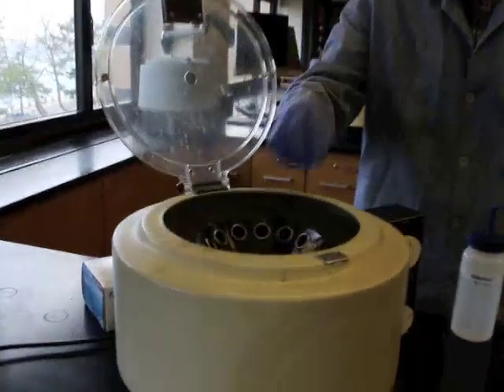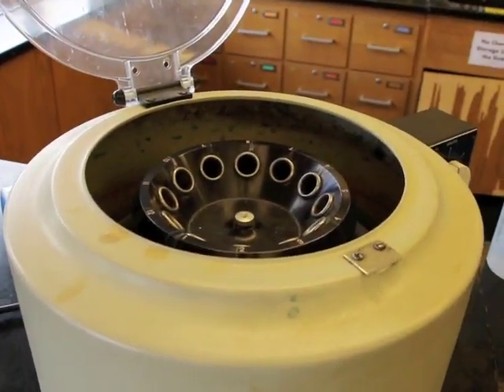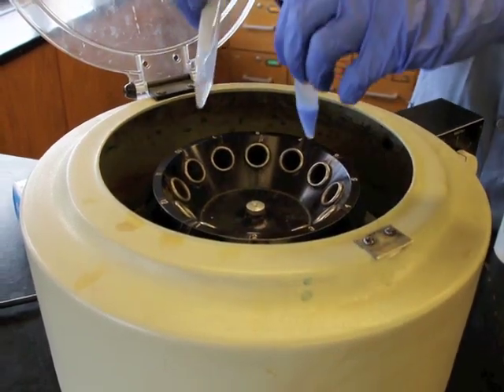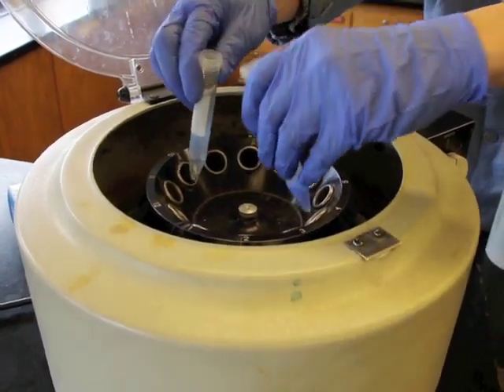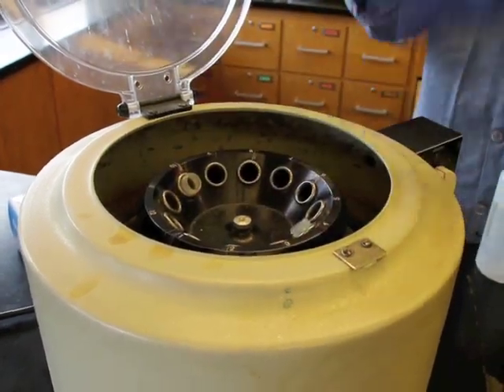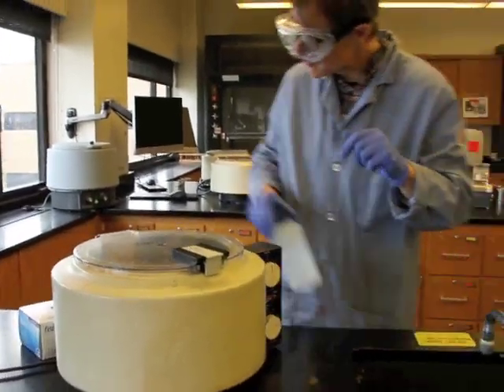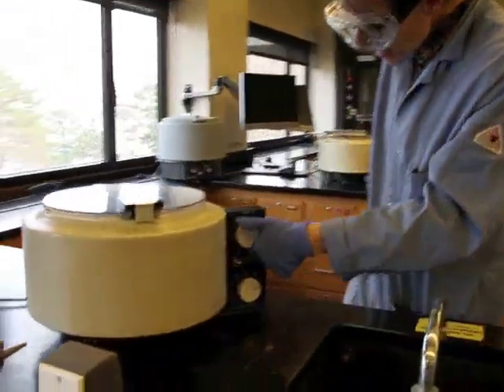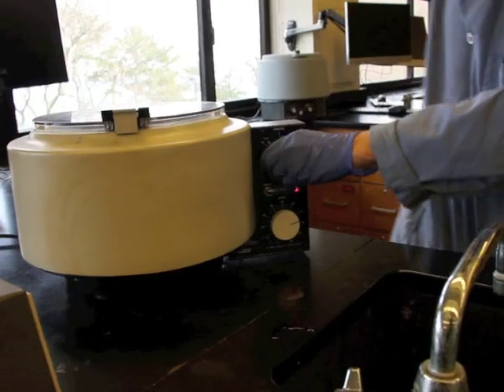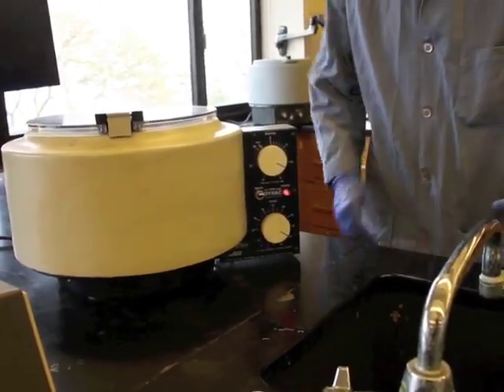Here's the centrifuge. There's a test tube in there. We're going to take that test tube out. We don't need that one. And we're going to put these into opposite sides, just like a clock. So the opposite sides, 10 and 4, face them. Notice we don't need lids on them because the force of gravity is downward, the force of the rotation is downward. And I'm going to turn this on. And we're going to run this for a couple of minutes at relatively high speed.